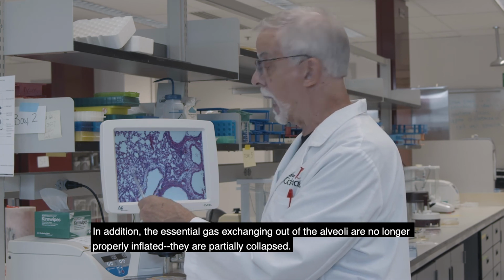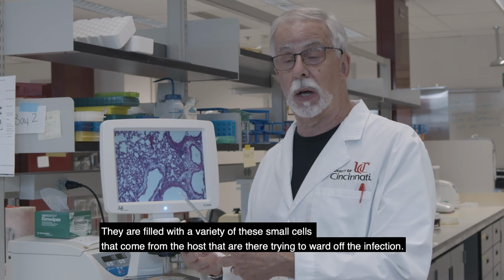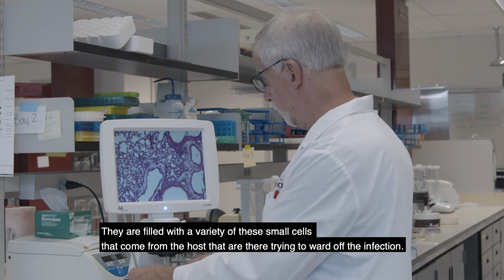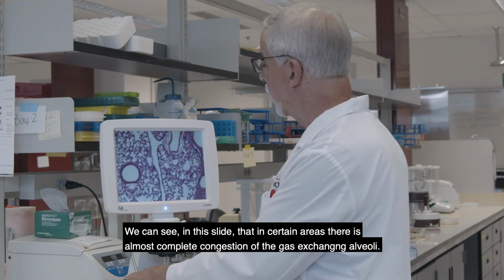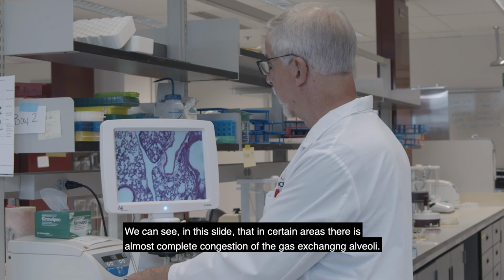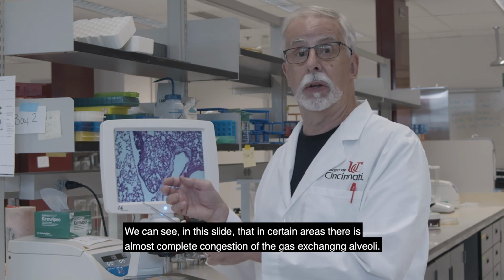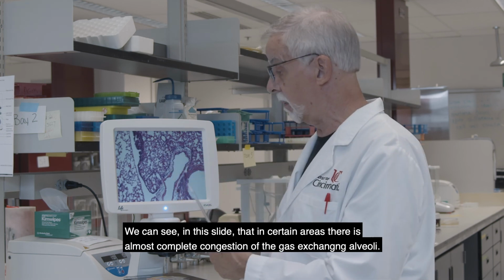They're partially collapsed, and they're filled with a variety of these small cells that come from the host that are there trying to ward off the infection. So we can see in this slide that in certain areas there's almost complete congestion of the gas exchanging alveoli.